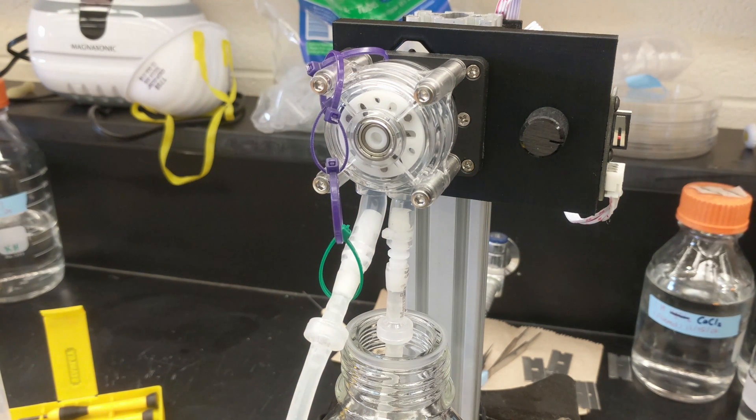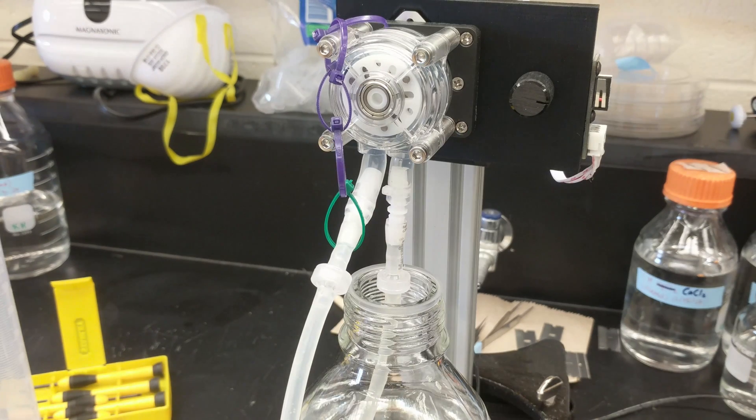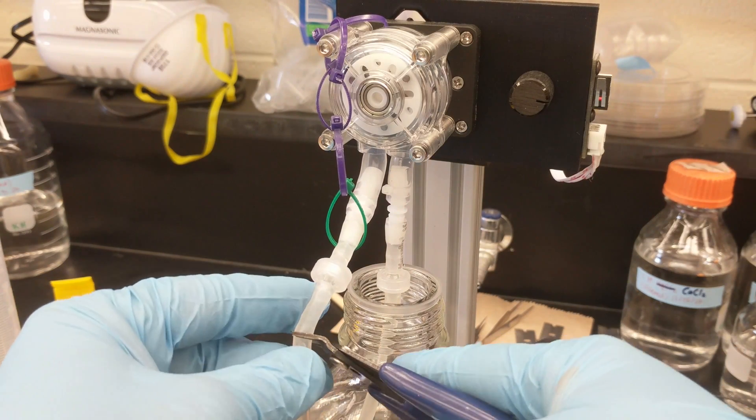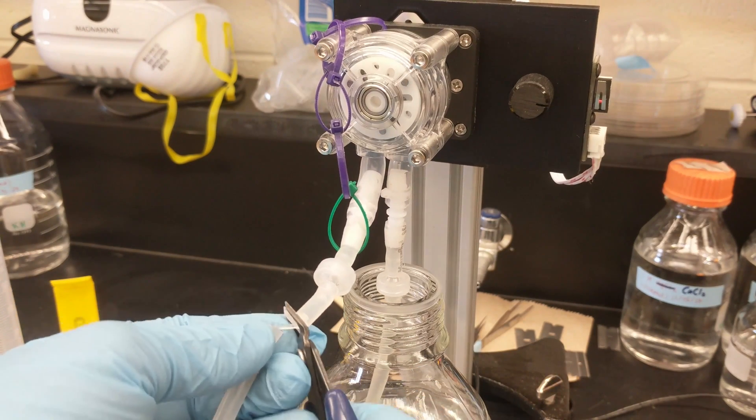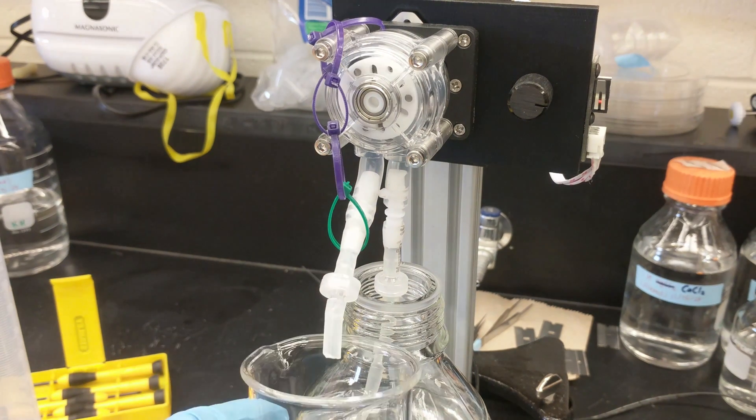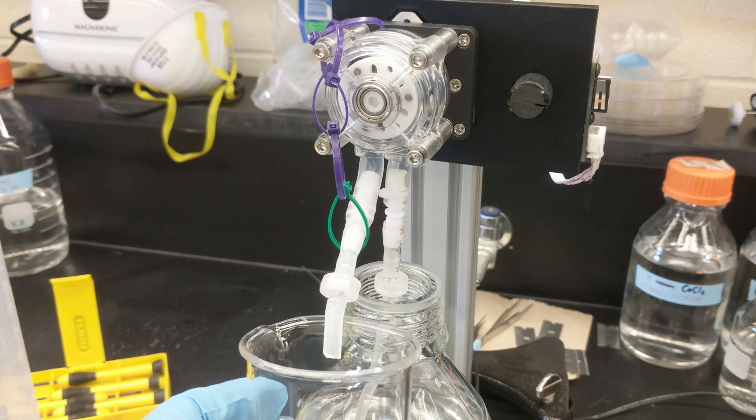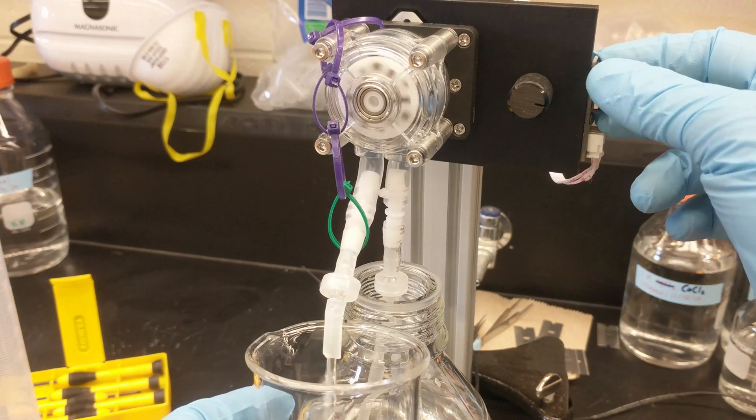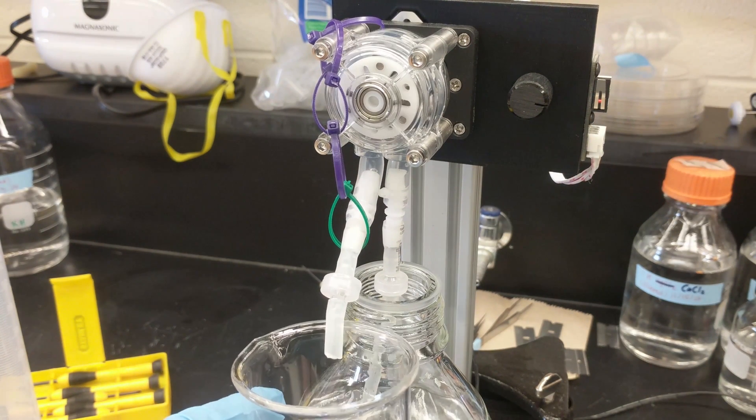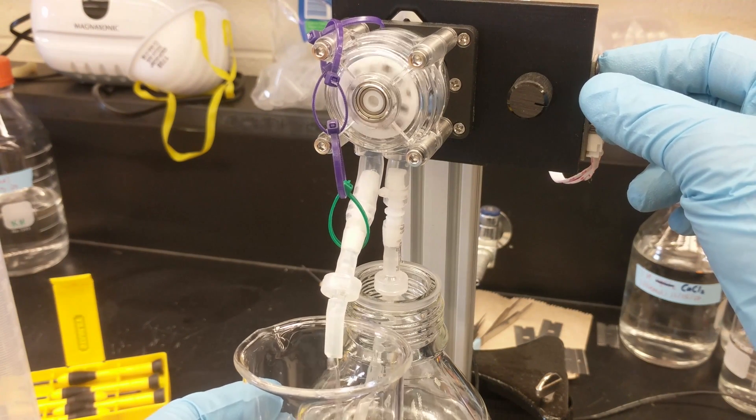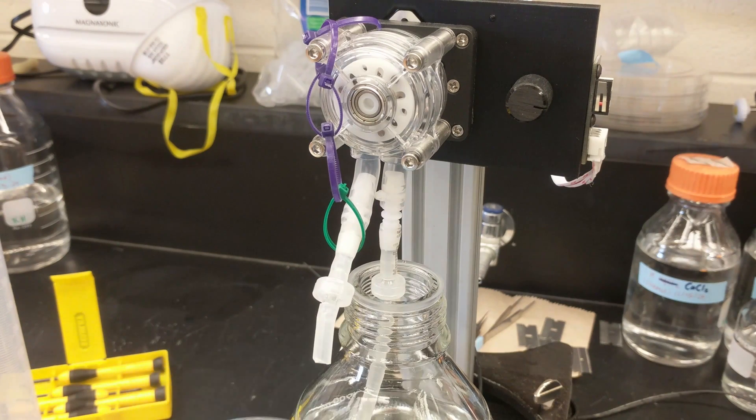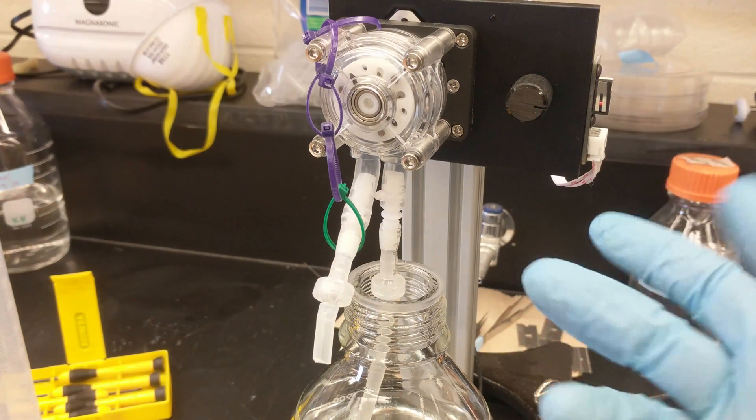So let's see it work. I have this set now for about 10 ml and we'll just dispense 10 ml right now. I'm just gonna cut this off so you can see everything a little bit better. All right, so I'm just gonna press this button right here and as you can see it's actually pretty fast.